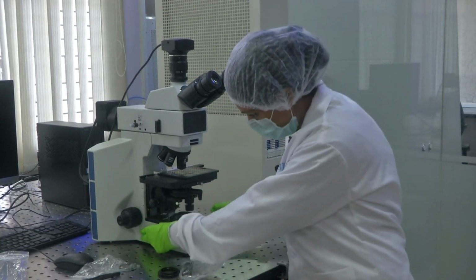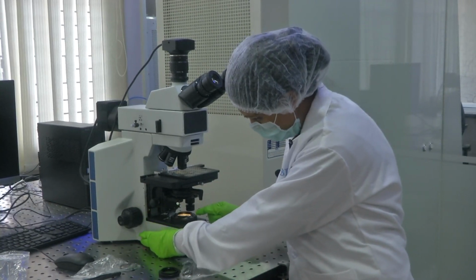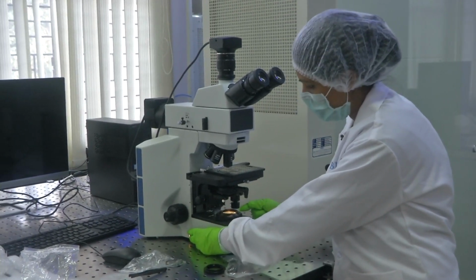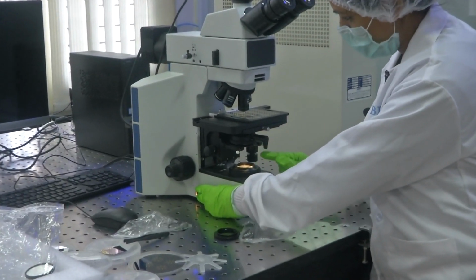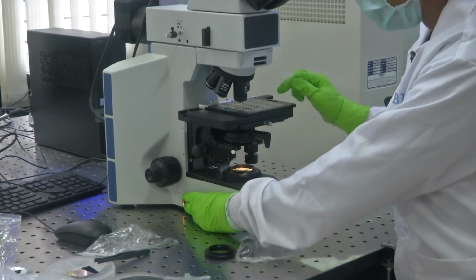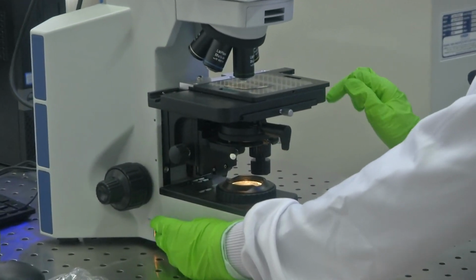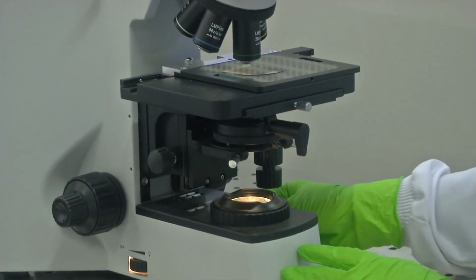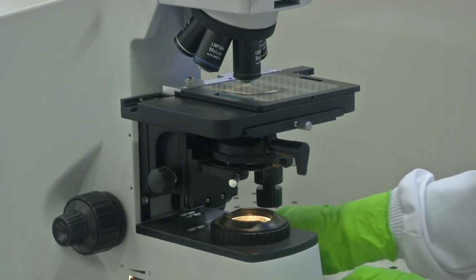Like I mentioned about the light source, this is throwing light from the bottom. If you could see, I have varied the intensity to the maximum, and this is the light source which falls on the sample. So, there is an aperture through which the light actually falls here, and there is another light source for each of this which falls from the top.